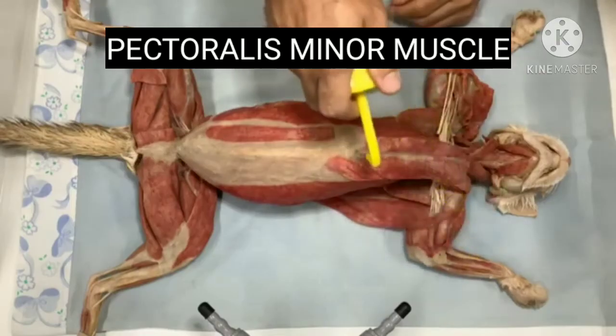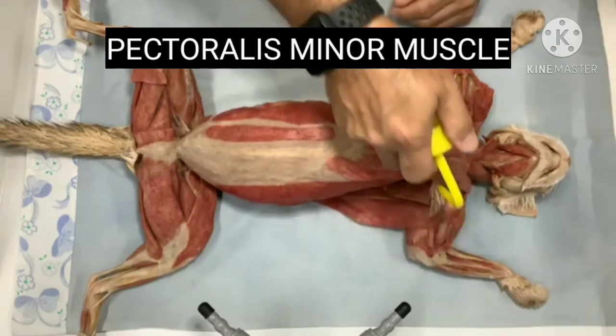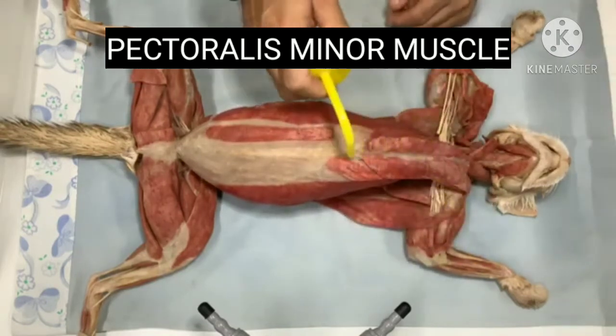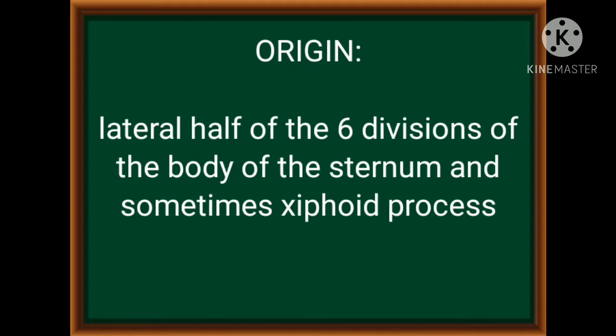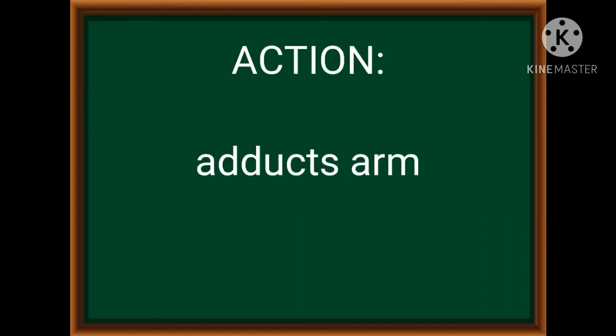Now let's proceed to the pectoralis minor muscle, which is just below the previous muscle, and its OIA. Lateral half of the six divisions of the body of the sternum and sometimes the xiphoid process. Ventral border of the bicipital groove and the proximal end of humerus. Adducts arm.